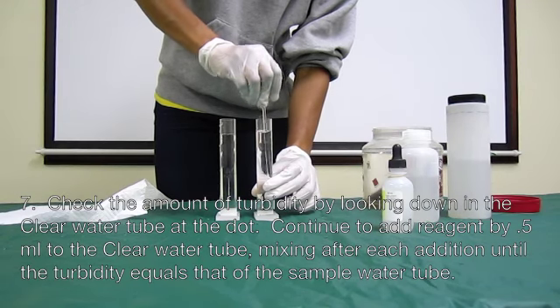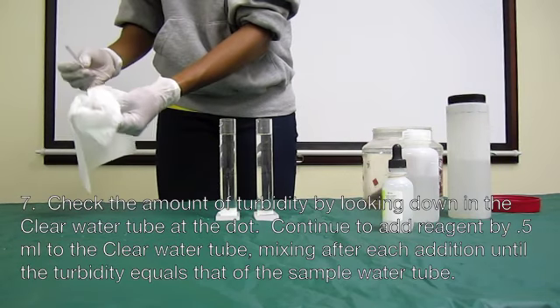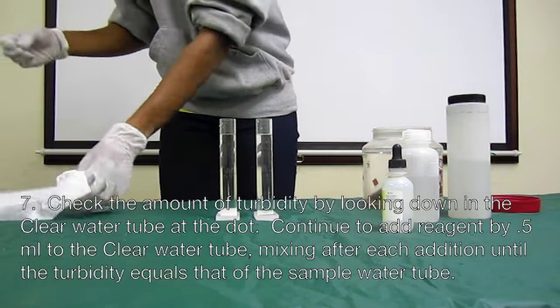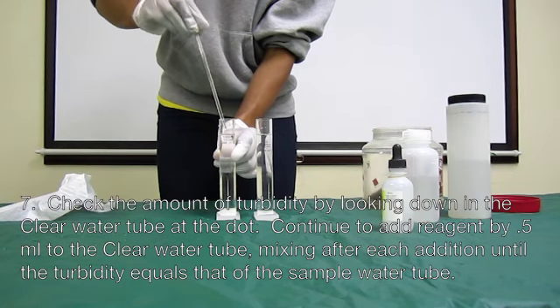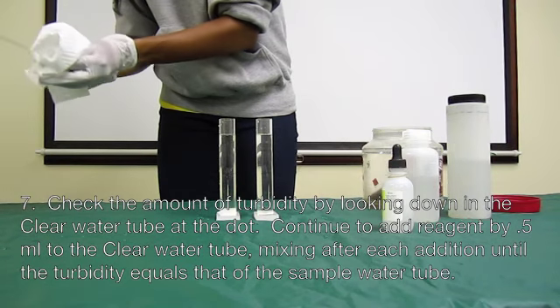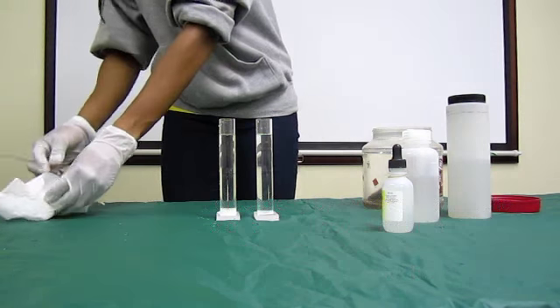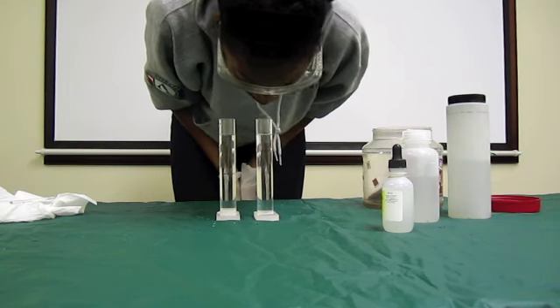Check for the amount of turbidity by looking down in the clear water tube at the dot. Continue to add reagent by 0.5 milliliter amounts to the clear water tube, mixing after each addition until the turbidity equals that of the sample water tube. So, both the dots in both tubes will be equally as fuzzy or as sharp.